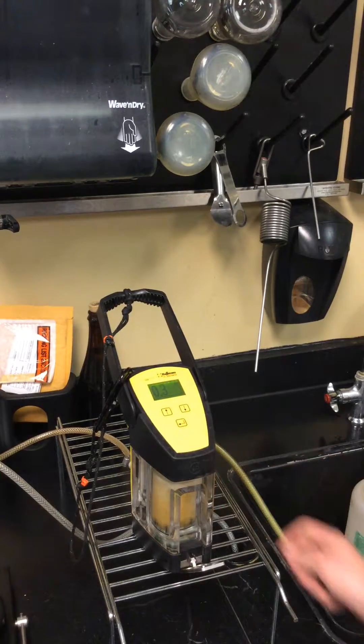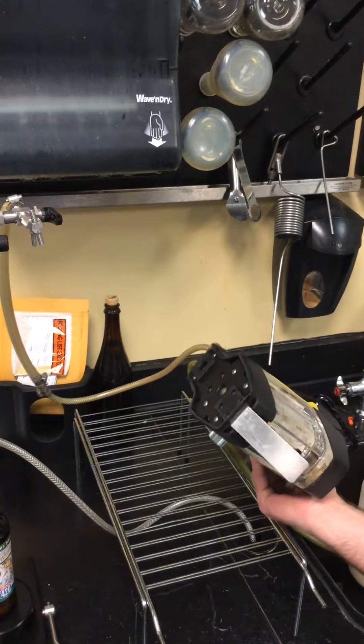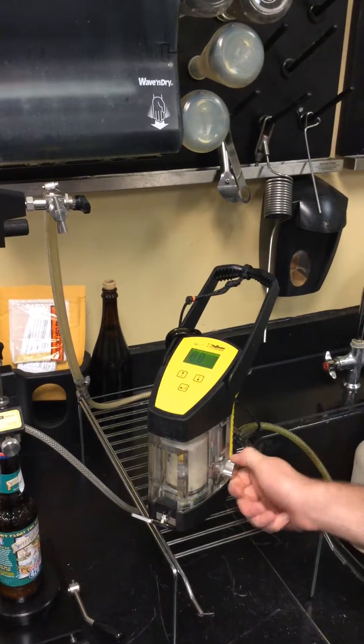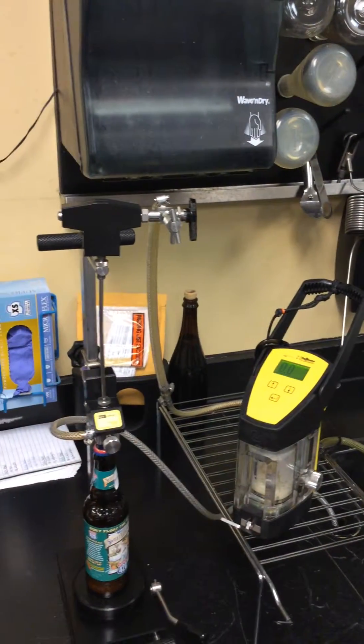Just blow it out, sell the product out, and close your right valve, and close your top valve, and close your gas off.